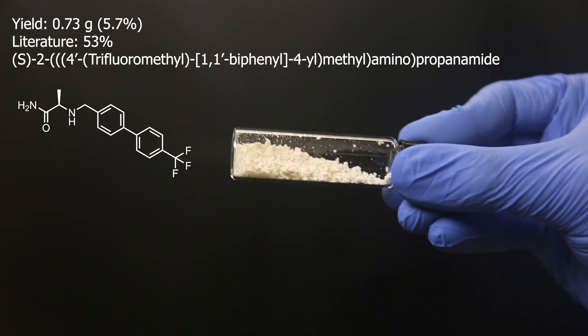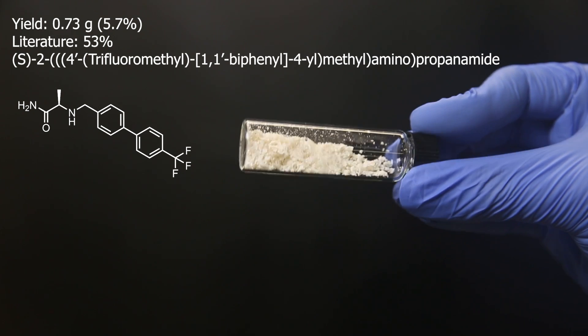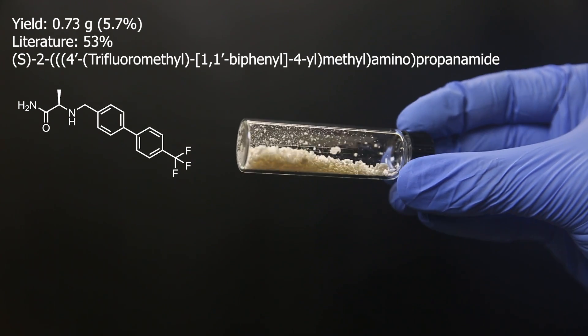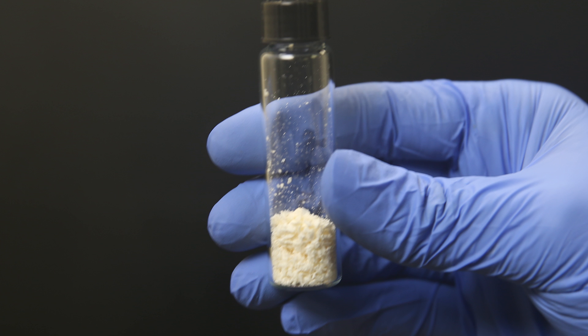This is definitely the botched work of hydrosilatrane. So now we also know you can't just simply substitute any reaction with it using a standard protocol. Expected, but unfortunate. Though at least it did do something to give a little bit of product.